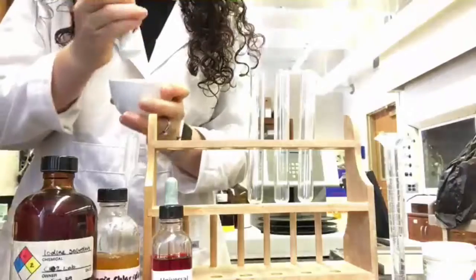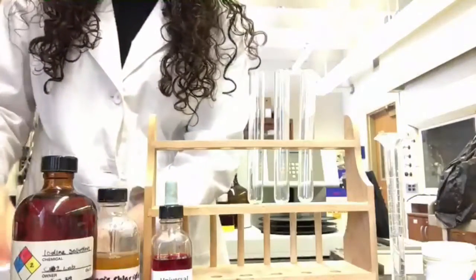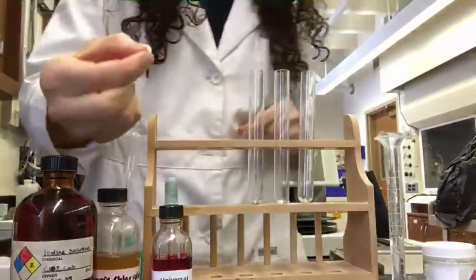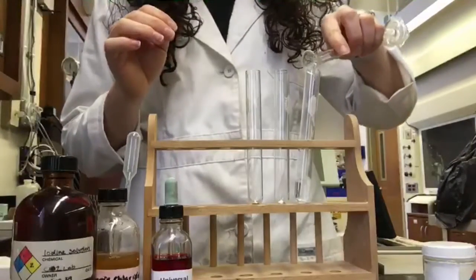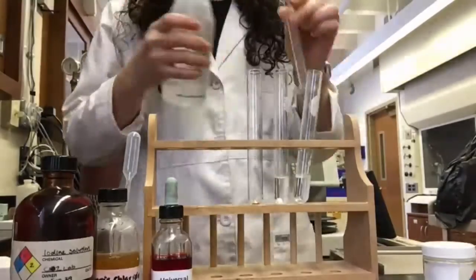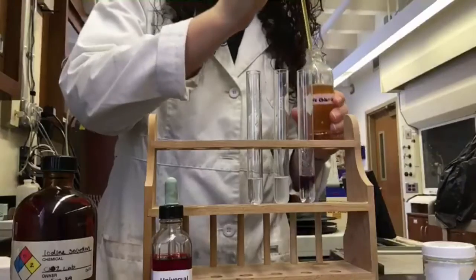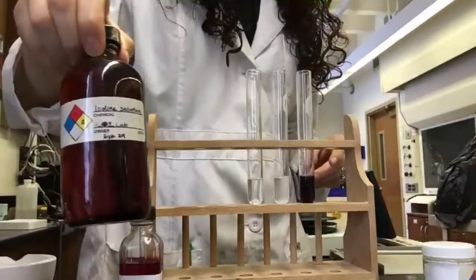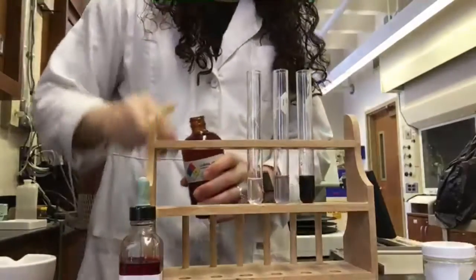First, you will test various materials using solution tests. You should put a small amount of each material into a test tube. Use an amount that is about the size of a grain of rice. You will then add water to your tubes to dissolve the solid component. Then you will add your color indicators. For example, if you are testing for starch, you will add the iodine reagent.